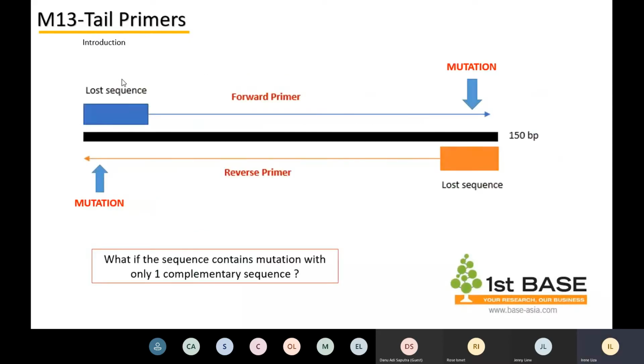Now, let me give you an example. The black color highlighted is basically the amplicon. So we know that for sequencing, basically you can sequence the full amplicon with just one primer. What happens is when you are sequencing using forward and reverse, you can get an overlap sequence. But when we use a normal primer, which means the amplification primer, for sequencing, we tend to have noise in the beginning. So literally you tend to lose at least about 20 to 30 base pairs in the beginning. Then only the sequence improves.